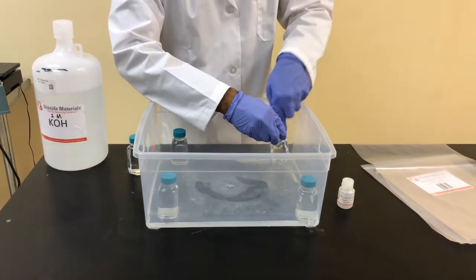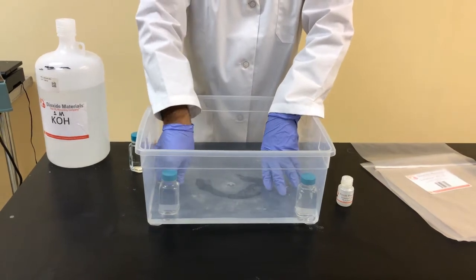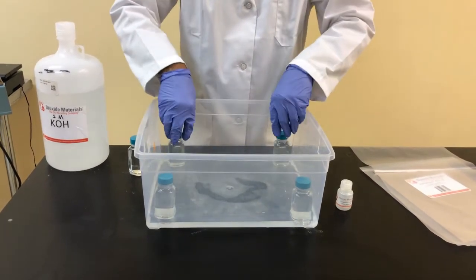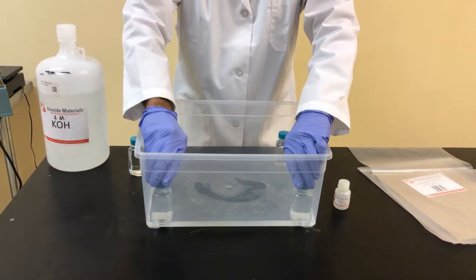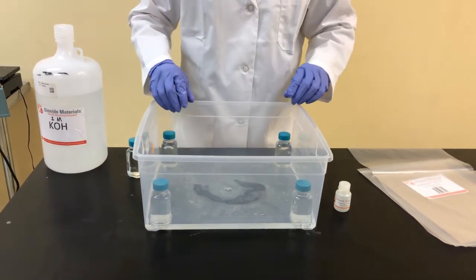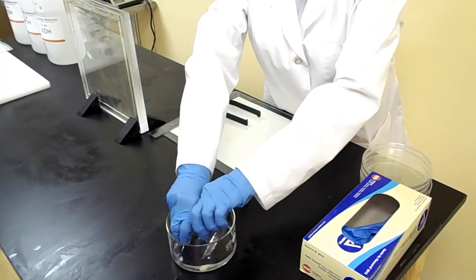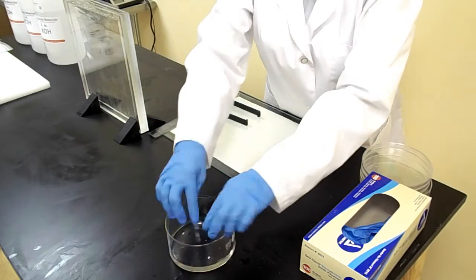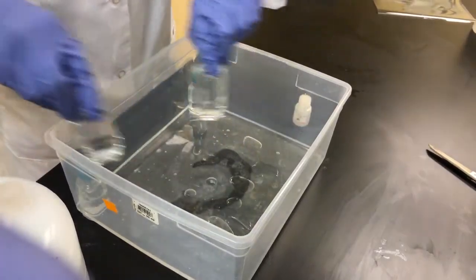This potassium hydroxide will activate the membrane and enable the liner to come right off. You also have the option to use a smaller beaker. Here we just cut a piece and placed it in one molar of KOH, where again it would sit there.